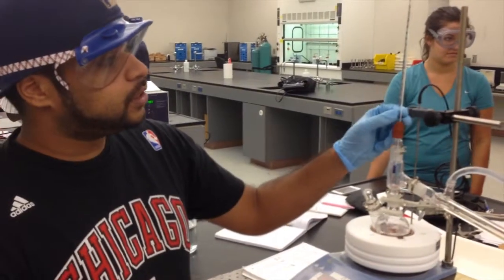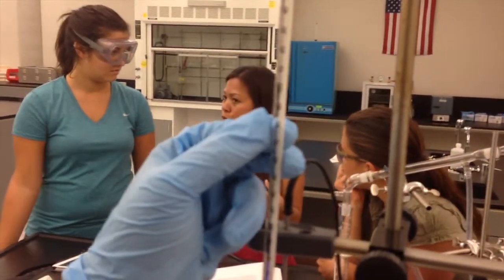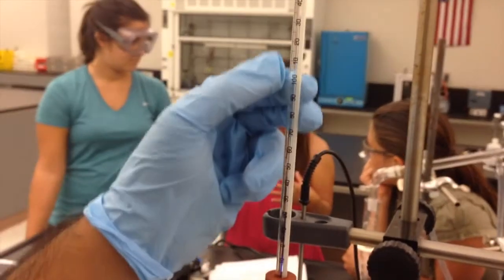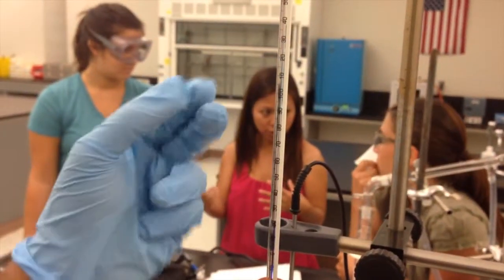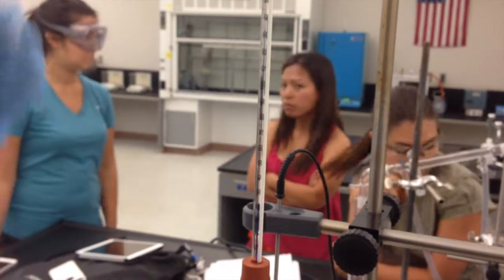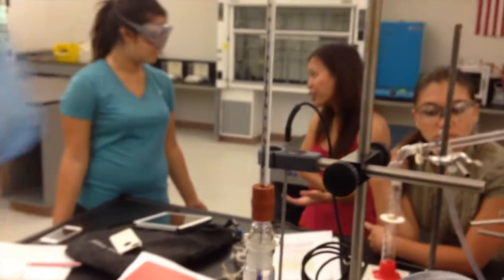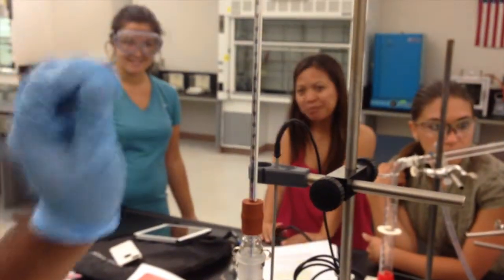The temperature itself is going to slowly start rising up to 80 degrees. Now, 80 degrees technically is the boiling point for cyclohexane. It can be 81, it can be 79. It's a range because technically speaking, we don't have the most accurate thermometer that we would have in a laboratory, but it's a very good range to collect it. Once we've collected at that temperature, we know that that's only cyclohexane because toluene boils at a much higher point.